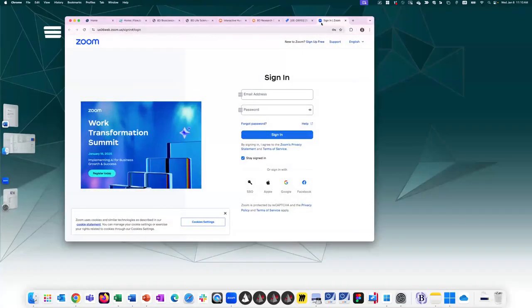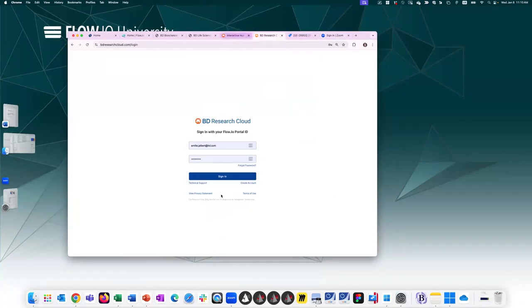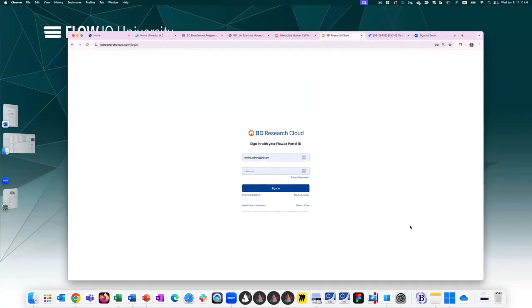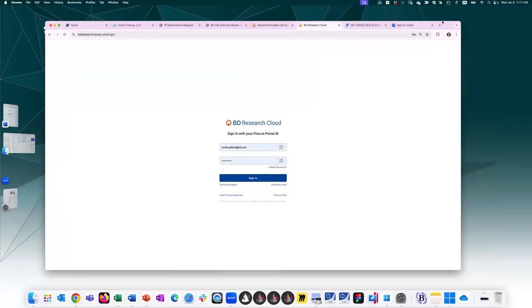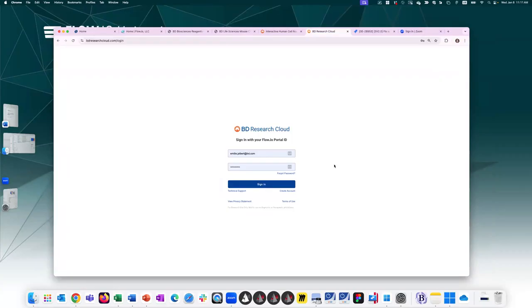Let's see here, Zoom. Okay, so here we are. Let's try and make this a little bit bigger. So you can open BD Research Cloud on any browser. Just go to bdresearchcloud.com and enter your credentials here. Let me see if I'm able to access the chat now. No, I don't know how to access the chat. I apologize. Let's see.